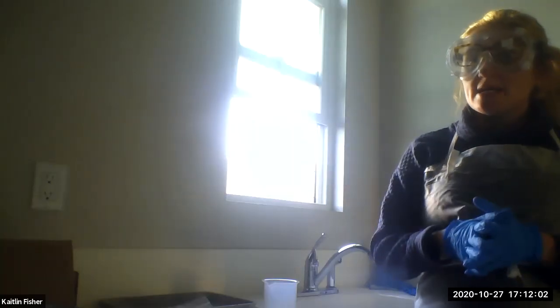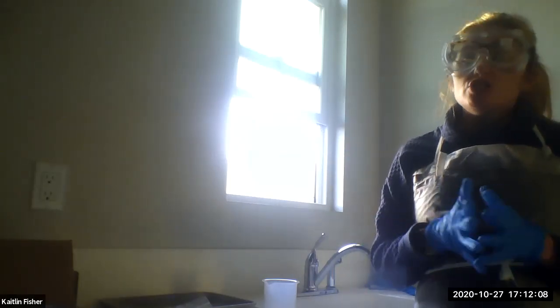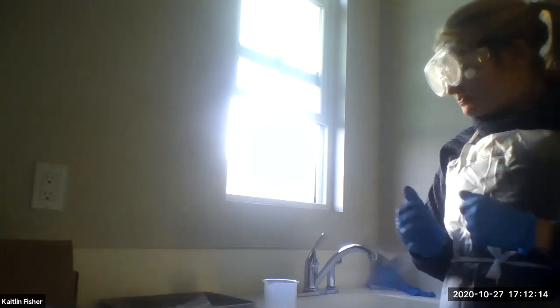As always, a reminder: make sure that you're in your safest workspace. We've talked about that. You want ventilation, you want a sink, you want a clean, wipeable surface. That could be your bathroom, your laundry room, or your kitchen, as we have discussed in the past.